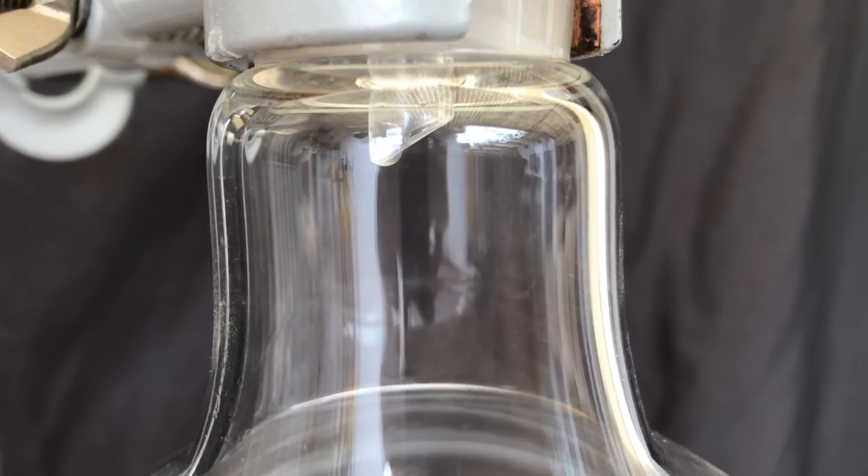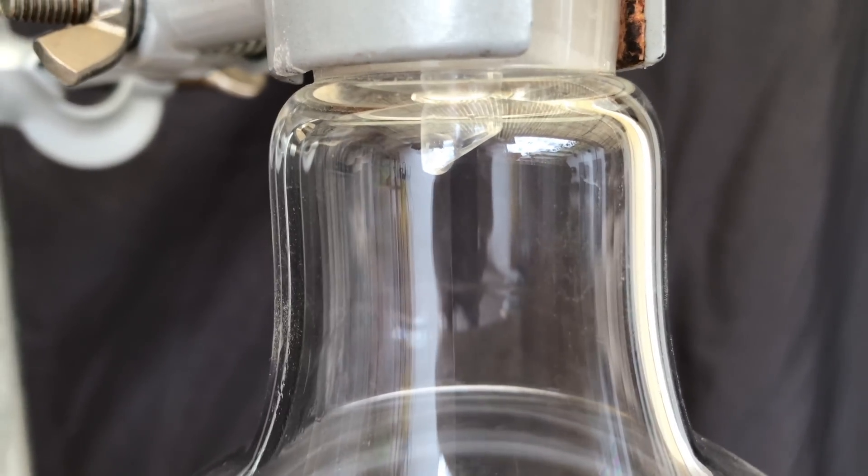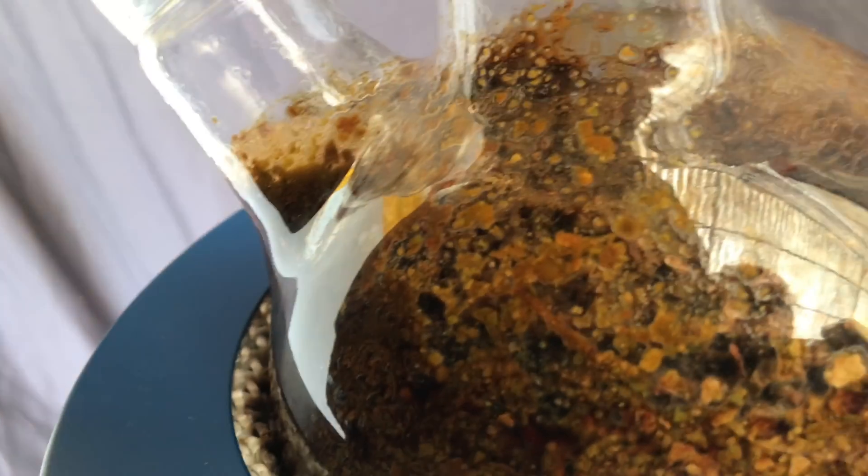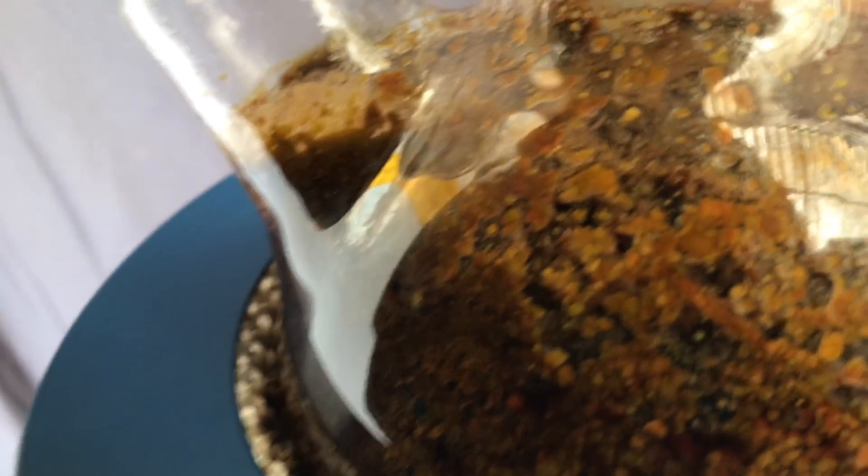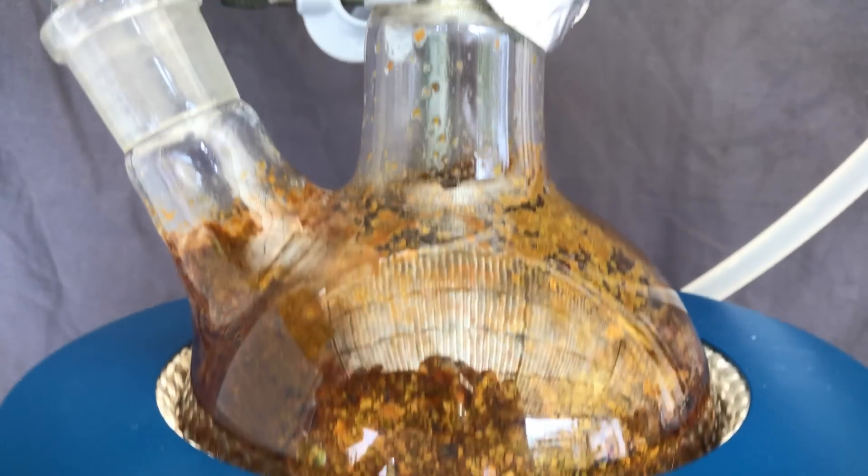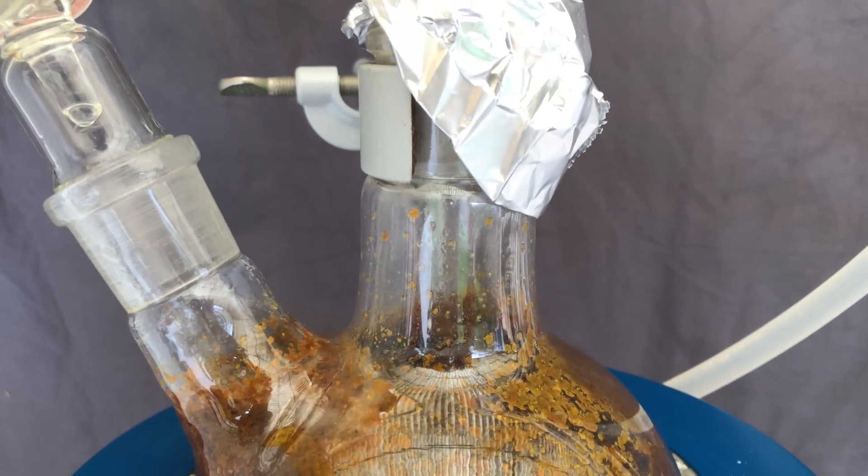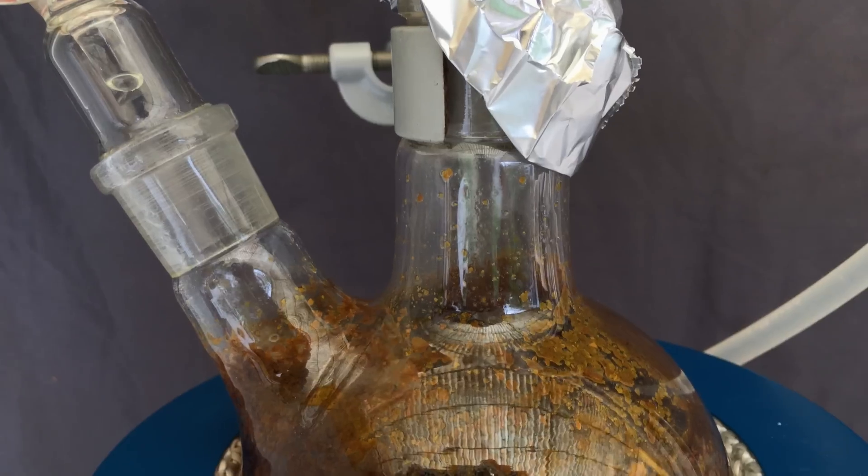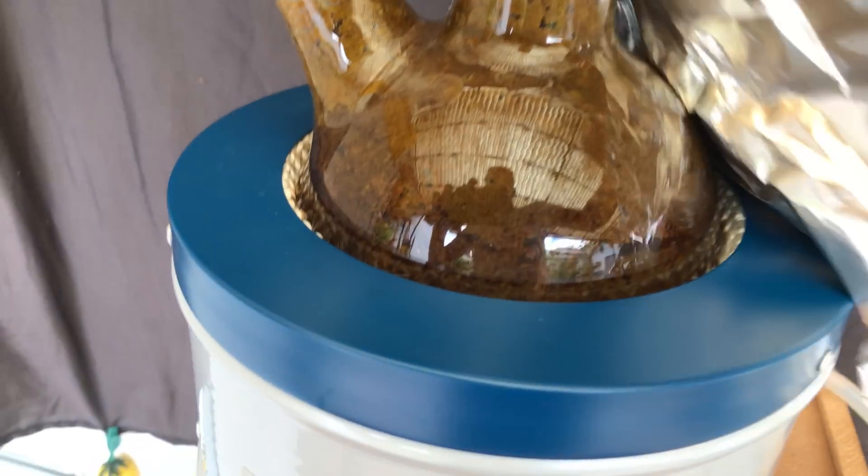This contains mainly water with a minuscule amount of nicotine. When the temperature isn't being carefully controlled, the tobacco might end up boiling over into the distillation bridge, contaminating the distillate. As you might know, I am extremely lazy and I hate waiting for my product to come over. Therefore, a part of the apparatus was wrapped in aluminum foil to speed up the process.